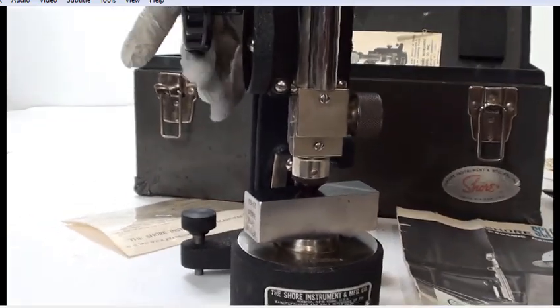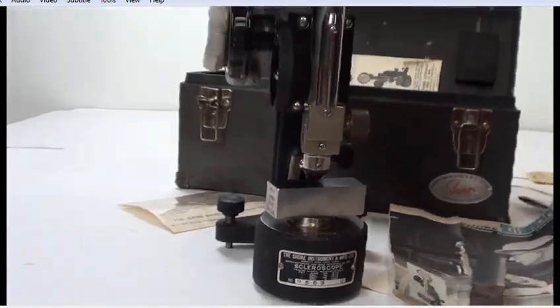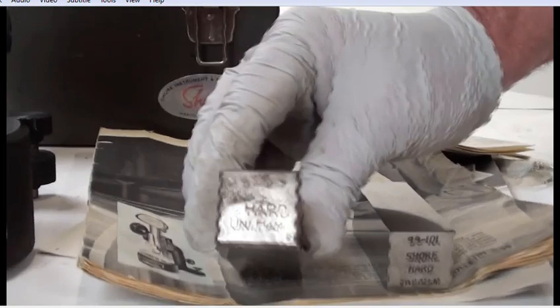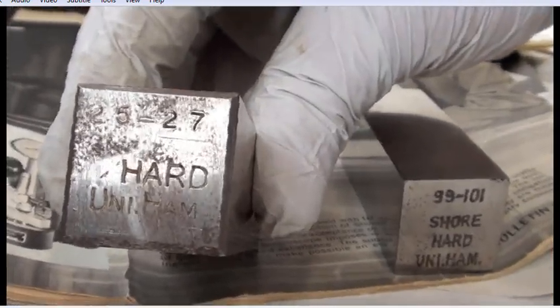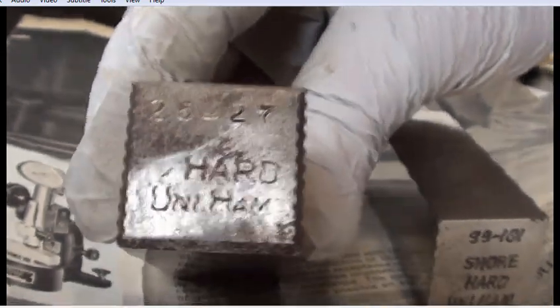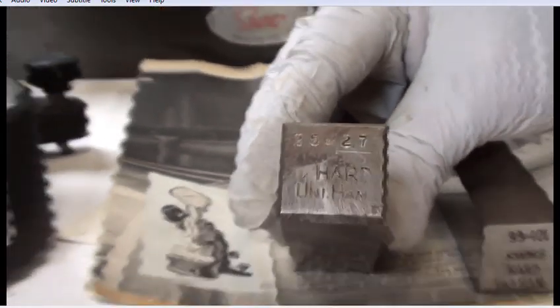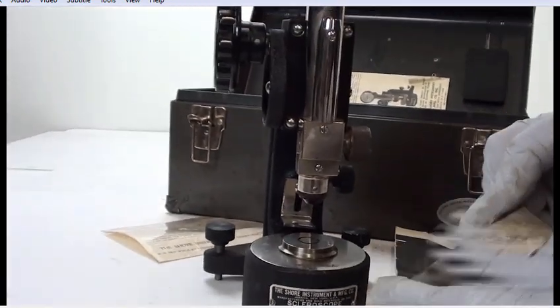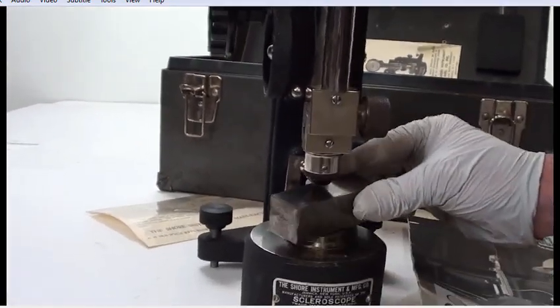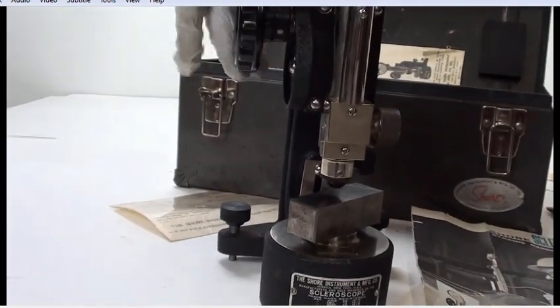Next, we'll go to the other standard. This is between 25 and 27. Make sure we have a clean surface. Let's bring the probe down.